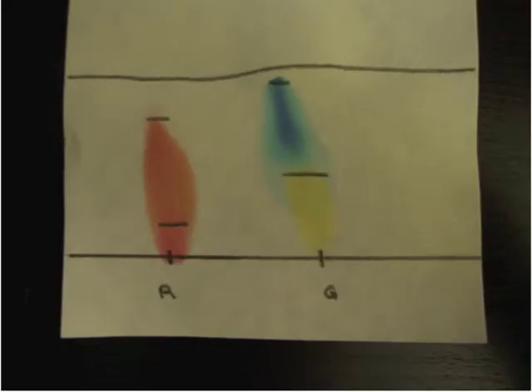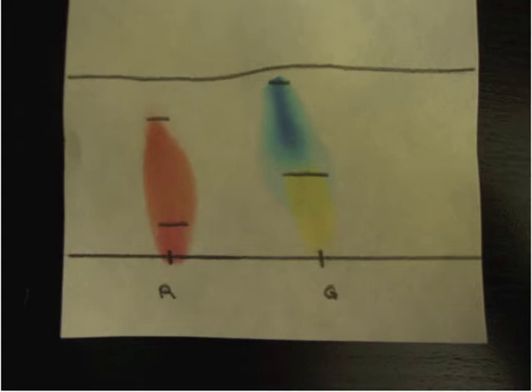When they are done, remove the chromatograms from the beaker. Mark where the solvent front ends because it will be impossible to see once it dries. Mark where each color component ends as well, then lay out to dry. Repeat these steps, but this time with the three unknown mixtures rather than the four known dyes.